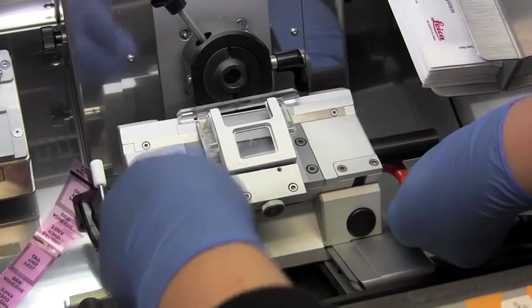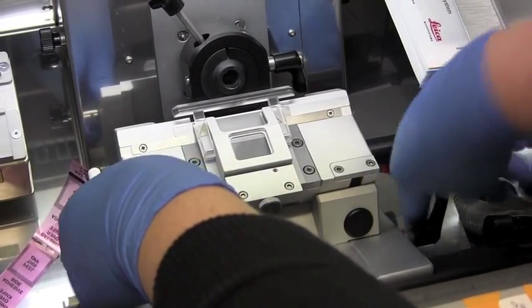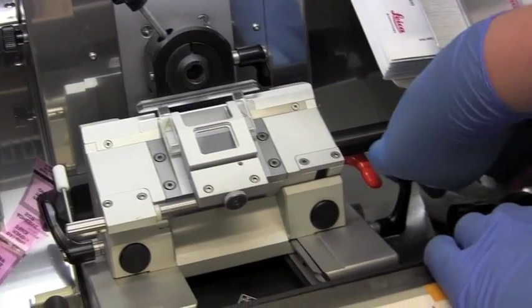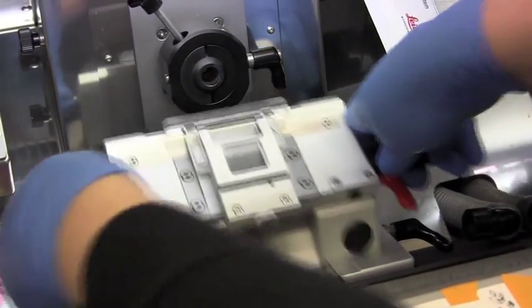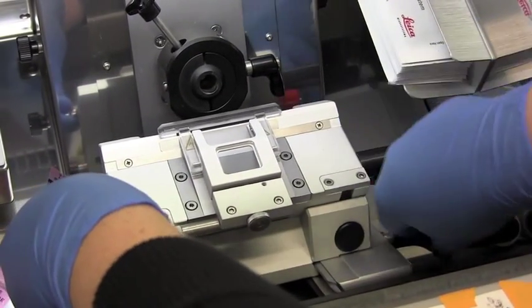And if you need to move the actual carrier back, you move this bar, and it can be moved up and down, like that.